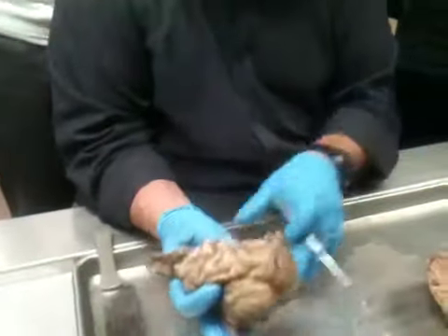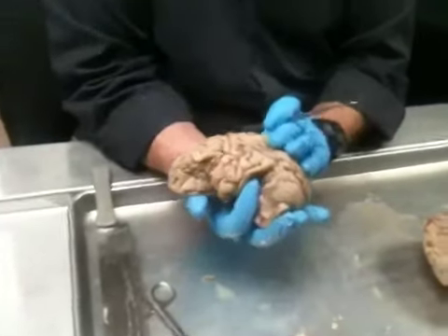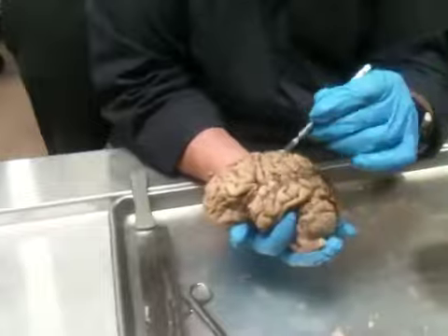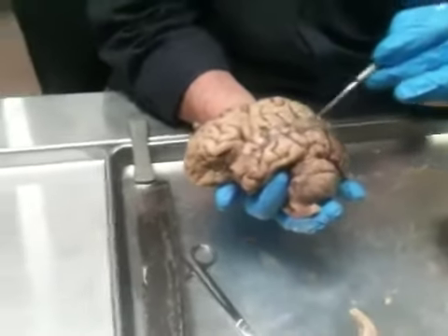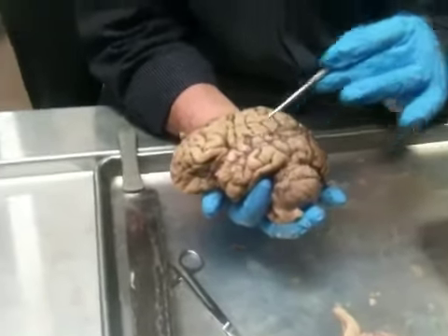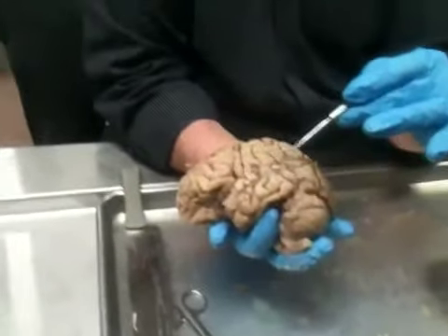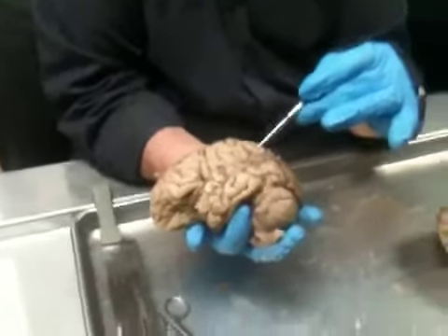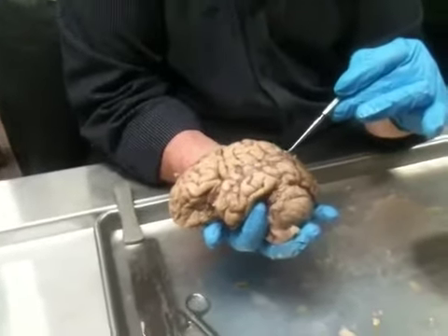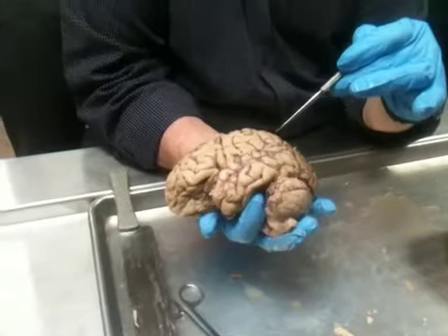On this, it's further up, it's not being cut in. So what you do is you look at this and you say, okay, I'm going to follow the lateral sulcus back, and it's going to end. I'm going to follow superior temporal sulcus back, and it's going to end. Well, all the superior temporal gyrus is area 22, and it's just this caudalmost part of area 22 that's referred to as Wernicke's area. And sometimes, like I said, it will sweep up into here. This area up here is area 39. Okay?